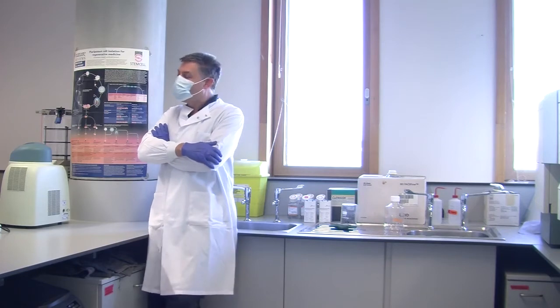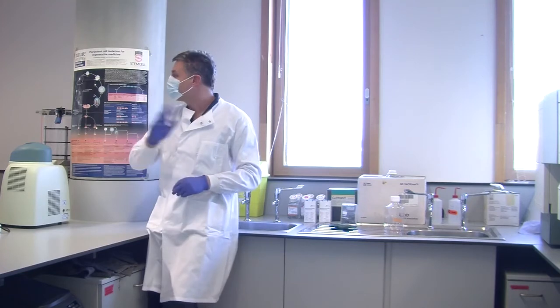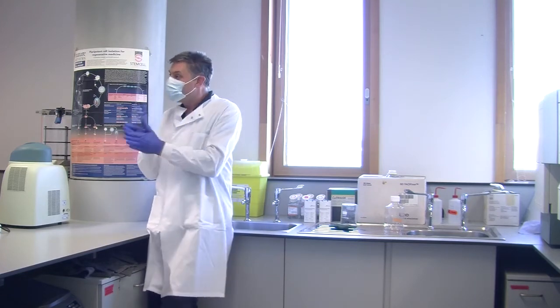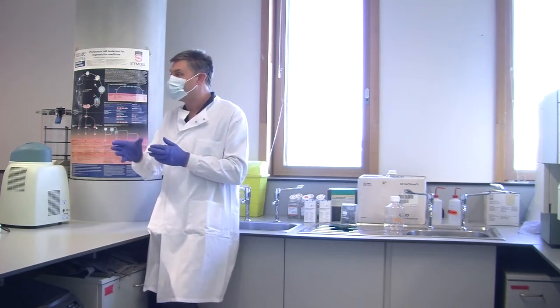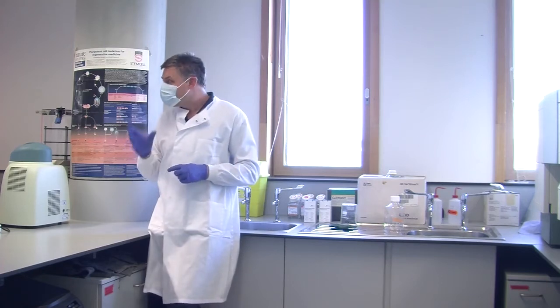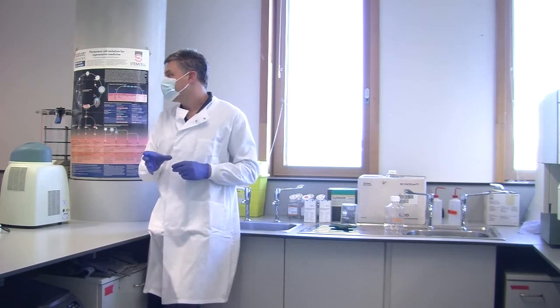And I'd say, right, what have we forgotten? And someone else would go, then put the tube in. Yep, exactly. So now it's full of air. So now we're going to have to purge it, and I'd use it as an excuse. But you could bet your life that that person, with the embarrassment of missing that step, never does it again. And so when it's safe to make a mistake, it's good to actually make mistakes in research.